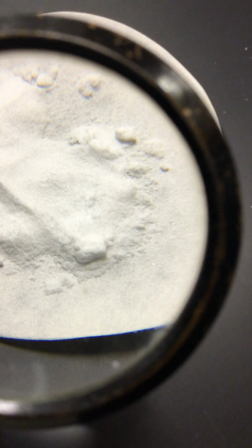Our third substance is sodium bicarbonate. This is sodium bicarbonate. Don't know if you can see that over there. There it is. And for these white substances, I got a little piece of black paper out so we can put these on here and get a look at what it looks like.